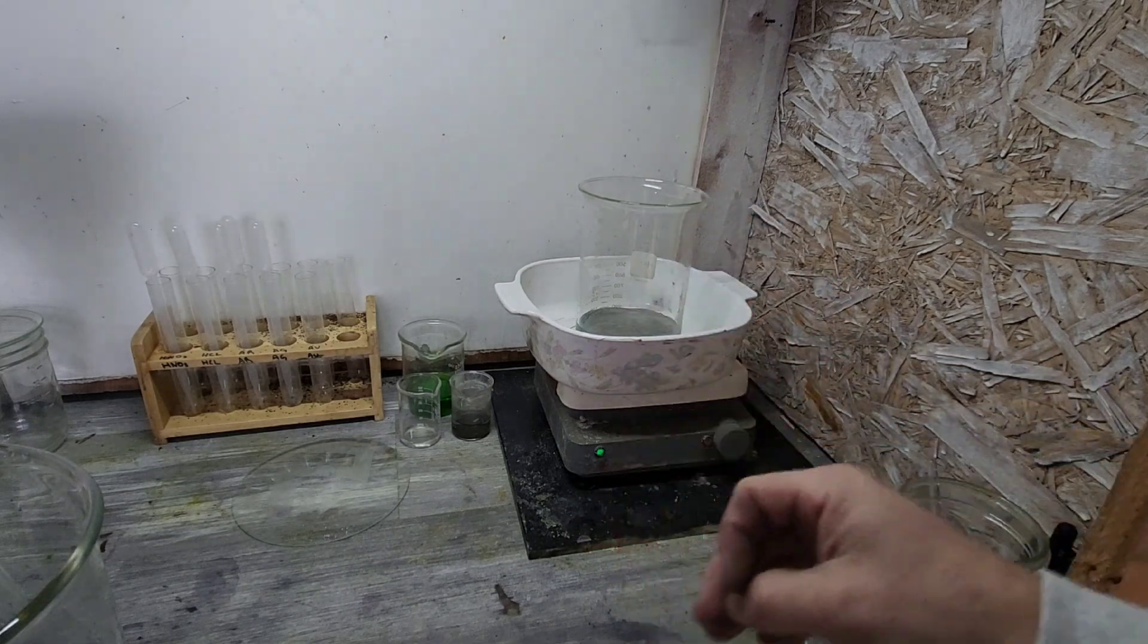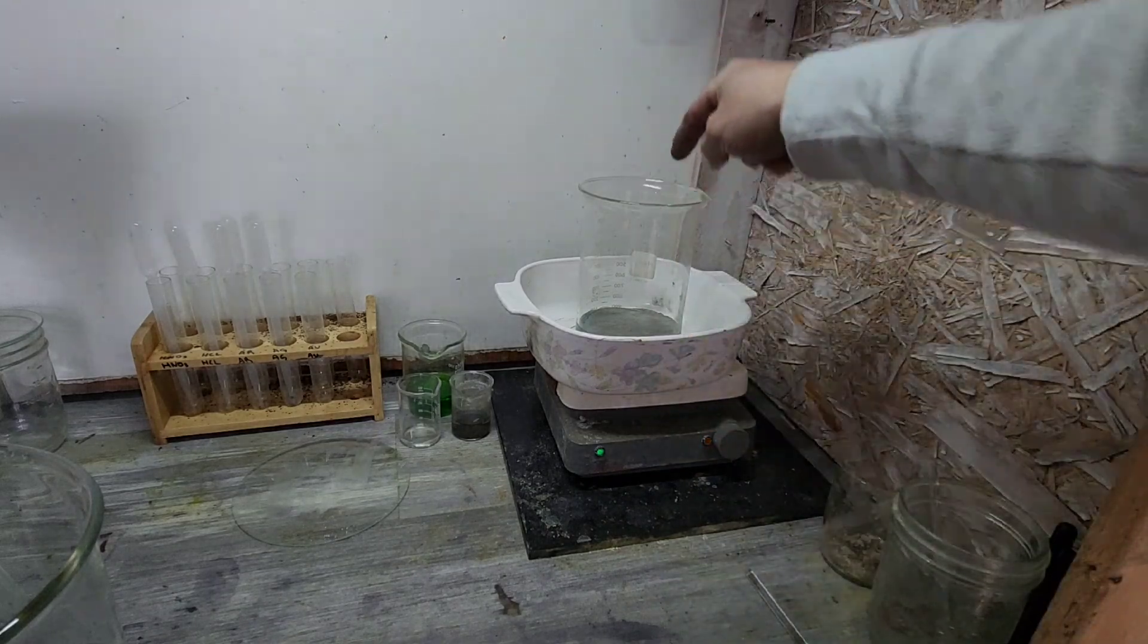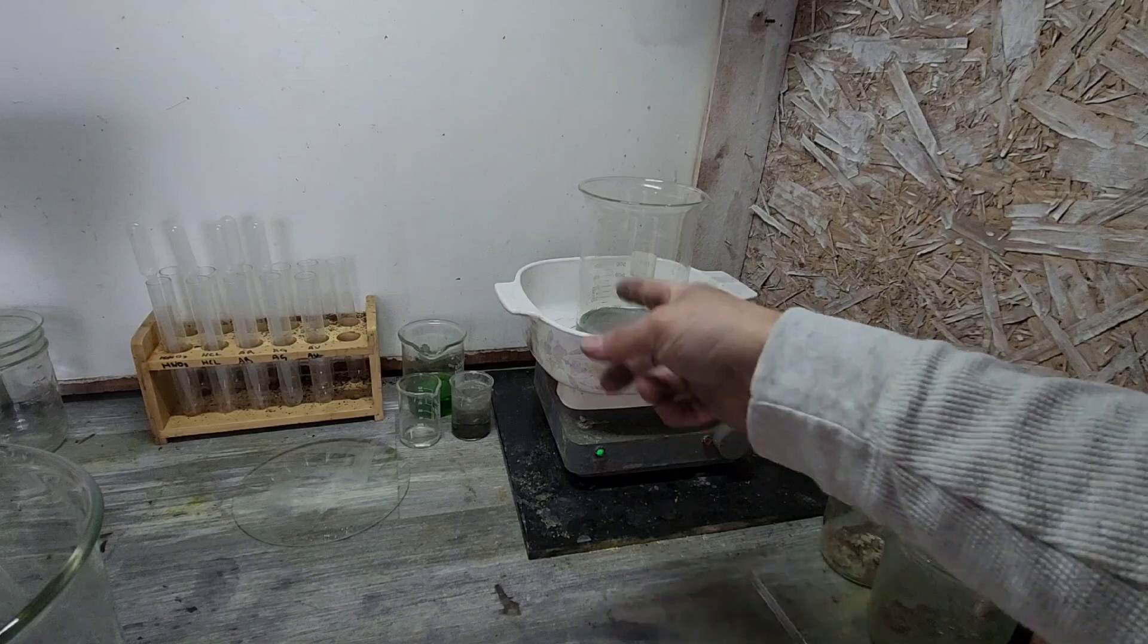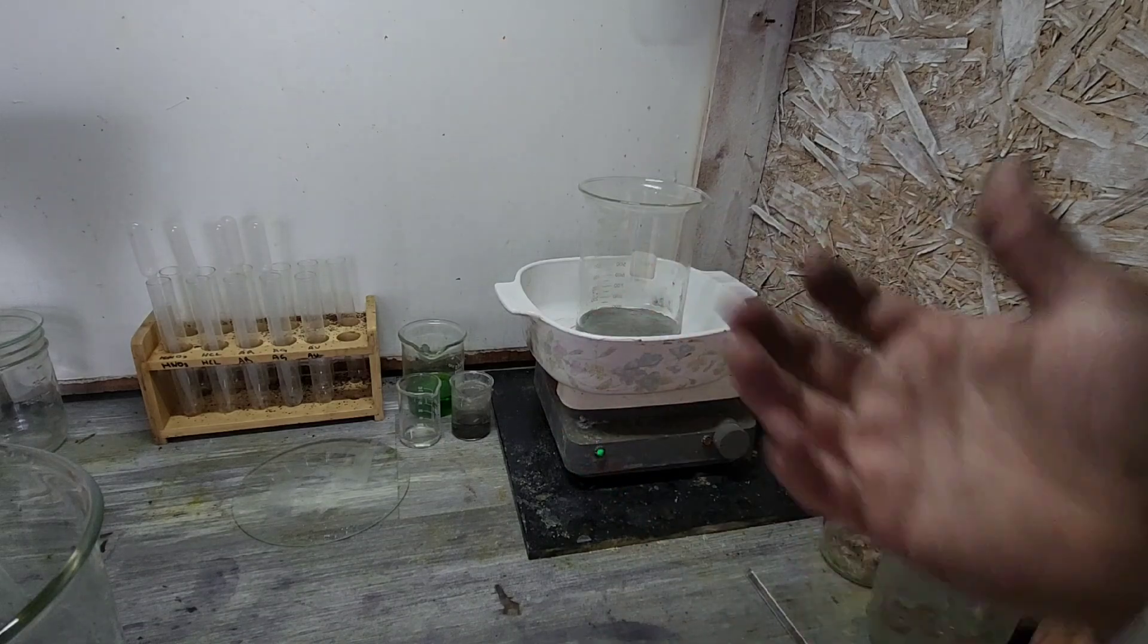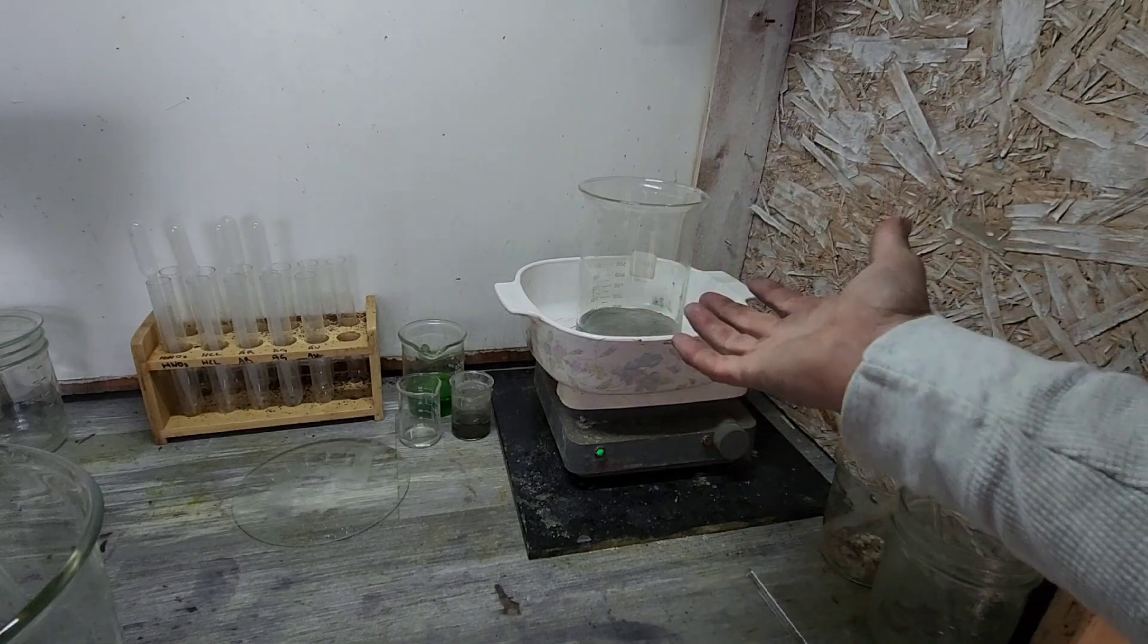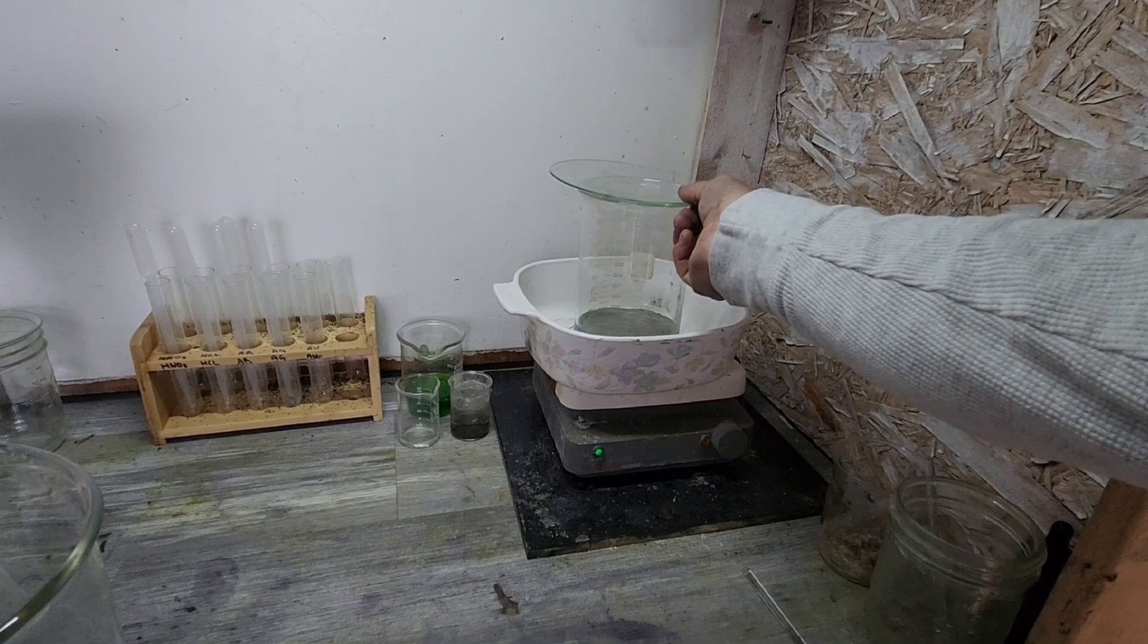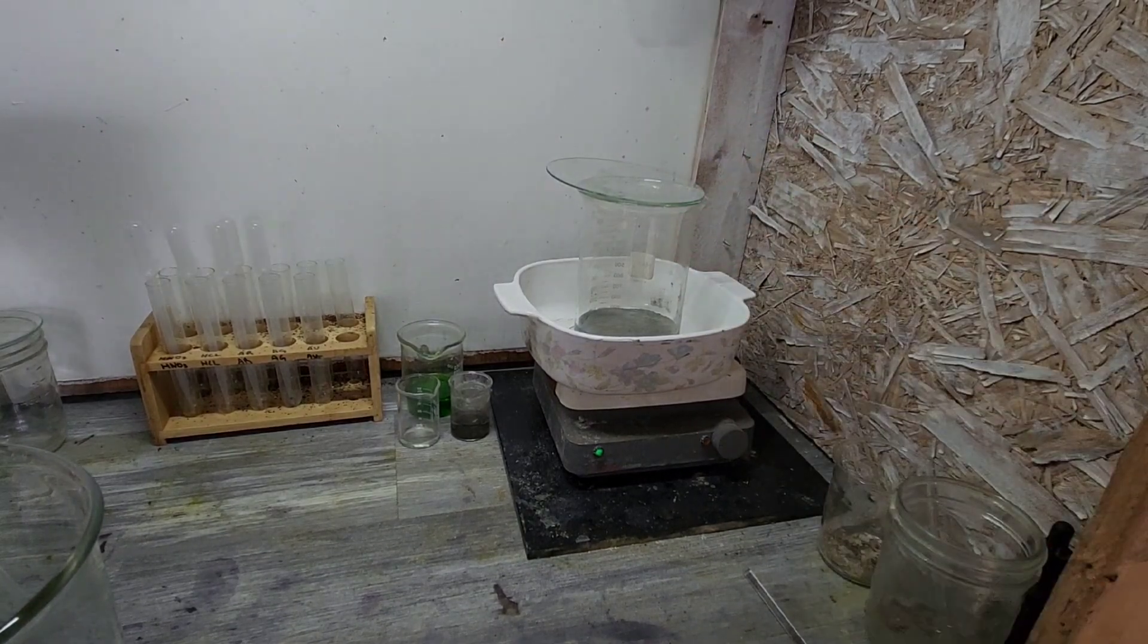So I still am in the processing or the experimenting stages of temperatures I should evaporate this at before we get into steam explosions. So I'm gonna go ahead and put the top on there. Yeah, it does make it go or take a little longer to fully do what I want by evaporating, because it'll collect on the top and then condense back, you know, and condense and then drop back down in there.